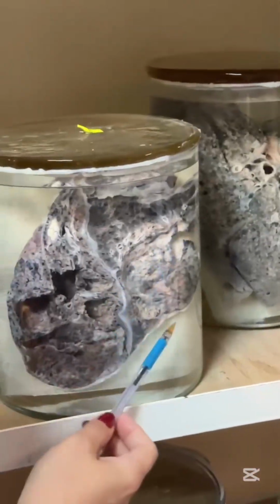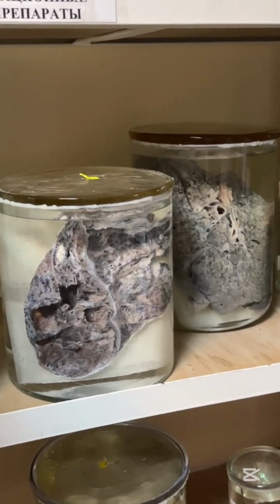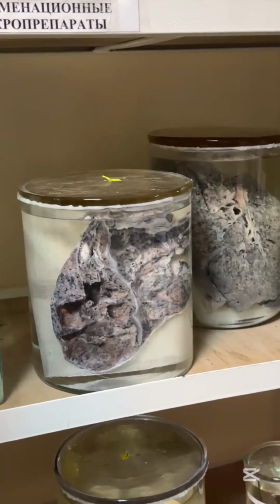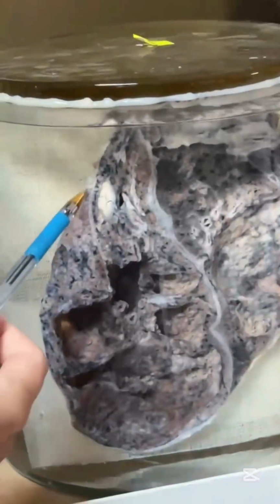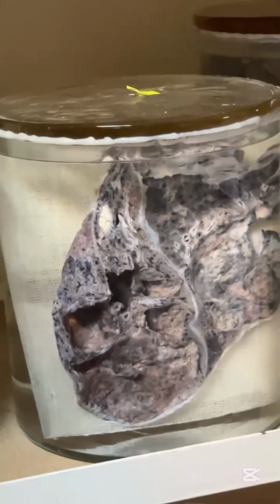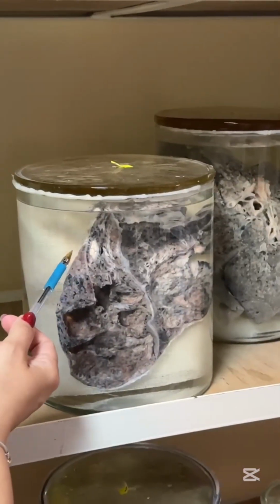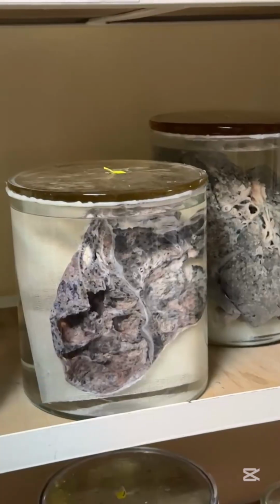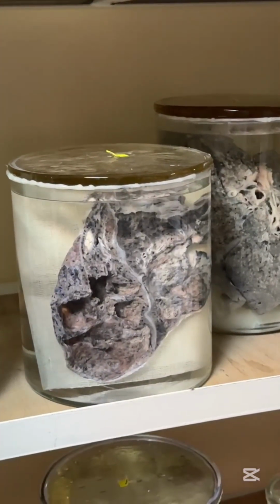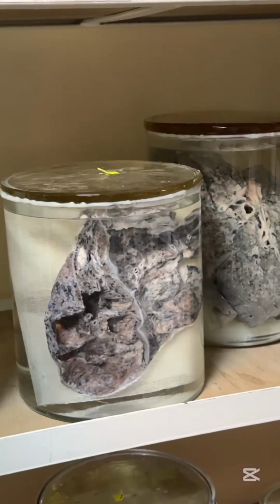You can see fibrous tissue lung and multiple cavities, caverns. That is secondary tuberculosis type, most common type of secondary tuberculosis, and in that area, this white spot, it was primary tuberculosis, Ghon's focus, and healing of it with calcification. That's why this area is white colored. So patient had primary tuberculosis, healing of it, then reinfection, and secondary fibrous cavernous tuberculosis.